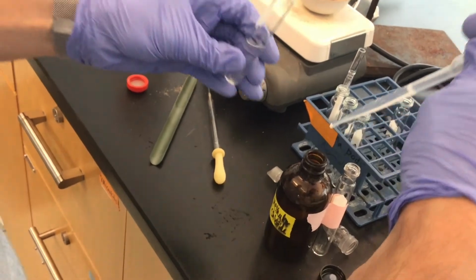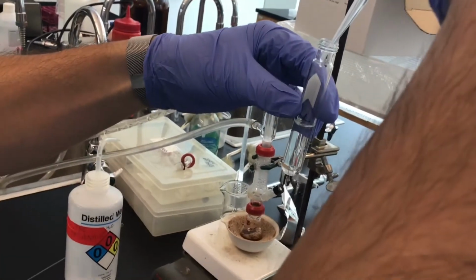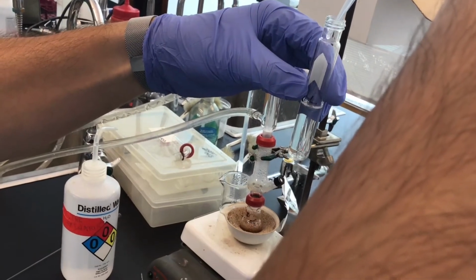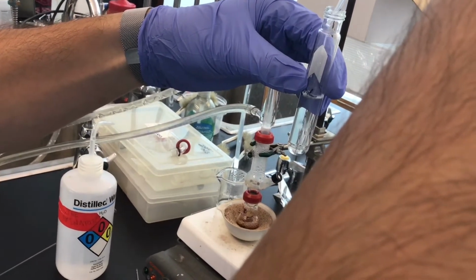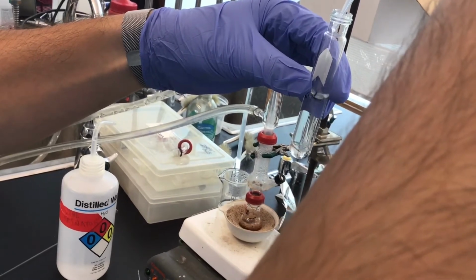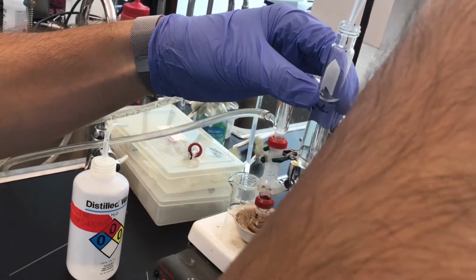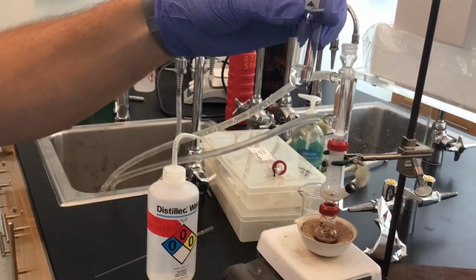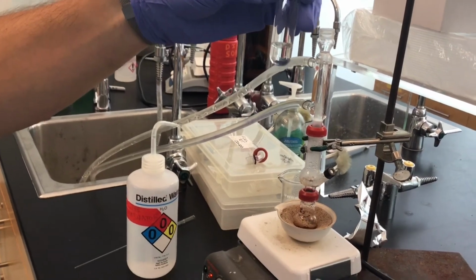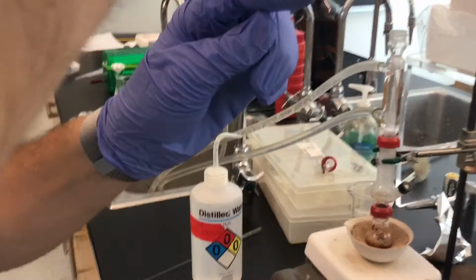So you'll note that once I add this methylene chloride, 2 layers form, and you see that the methylene chloride is hitting the basement level, so to speak. And once again, that's because it is more dense than water. And so now we've got 2 phases.